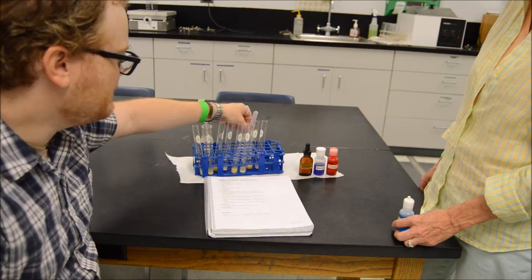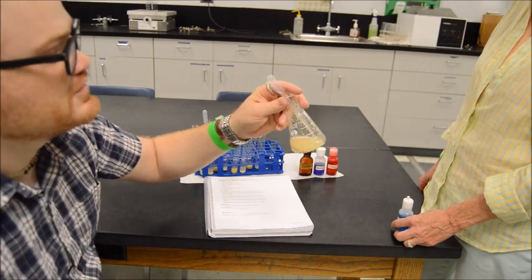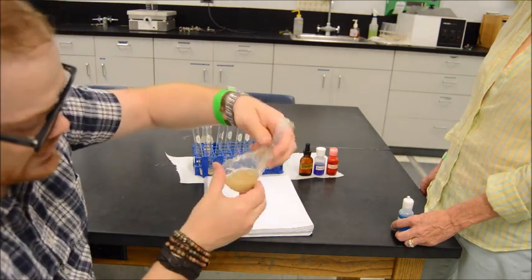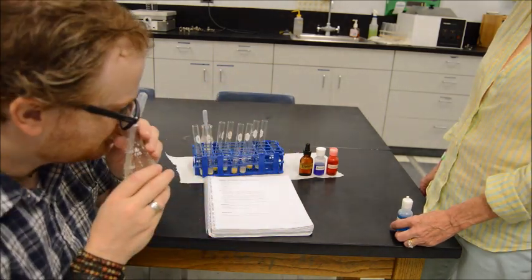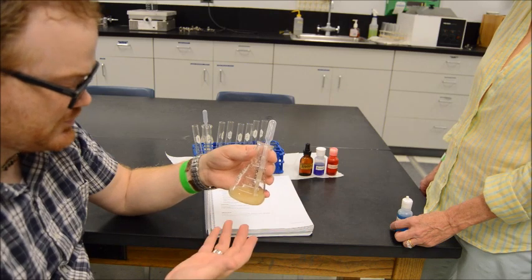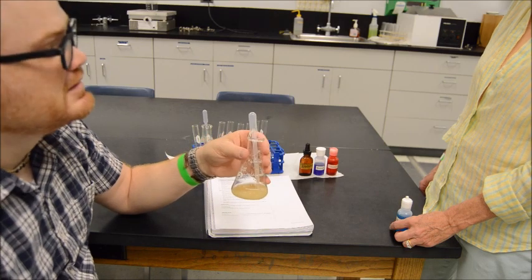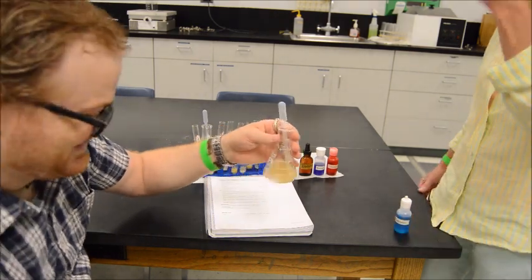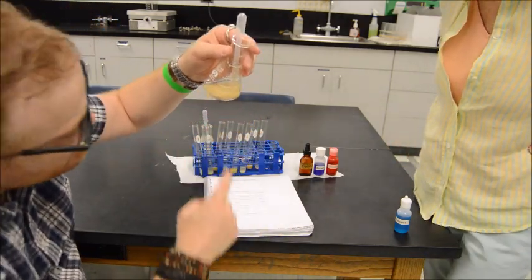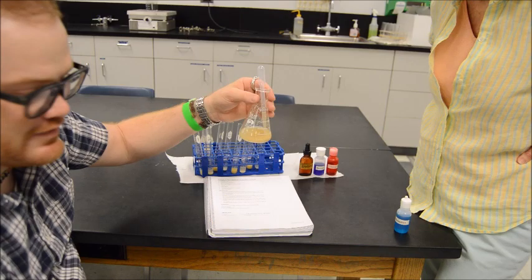The second one. This is quite particulate. This is full of stuff is the way I would describe this scientifically. There's stuff in here floating around. It definitely gets on the glass. You can see how it gets on the glass here. And it smells like food. There's definitely a food scent to this, but it's not that appealing. It's very drab. It's very bland, but definitely particulate. You can tell there's a little bit of dissolving into the water, but when I hold this, it really settles out. It wants to settle. So it's very particulate. It's very grainy, for lack of better terminology.